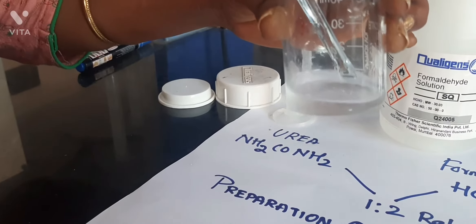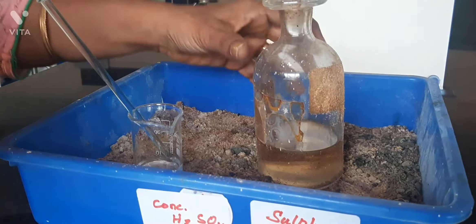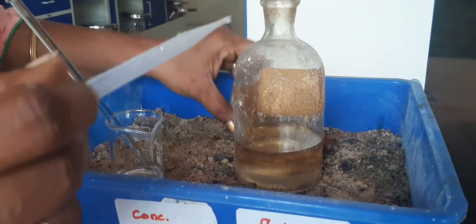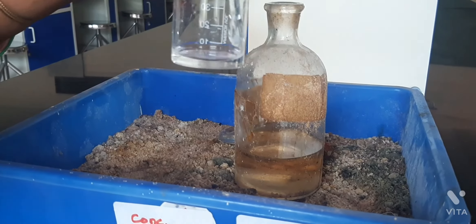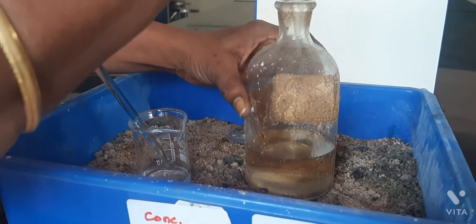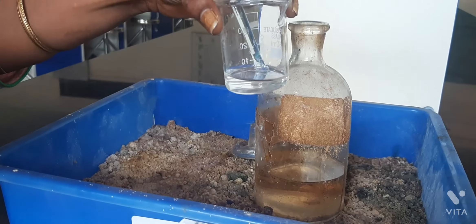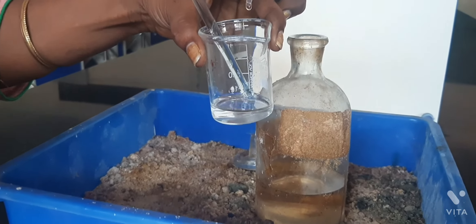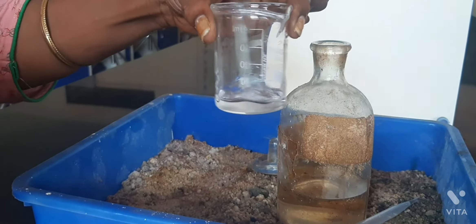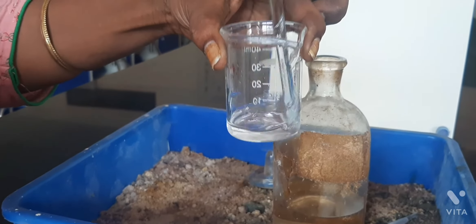While adding sulfuric acid, it is better to place the containers in the sand and then add sulfuric acid to the beaker. It should not be dropped onto the floor or onto our hand — it is a highly dangerous substance. Better to place it in the sand and then use it. When you add 1 or 2 drops and stir, you can observe a white color resin appearing.